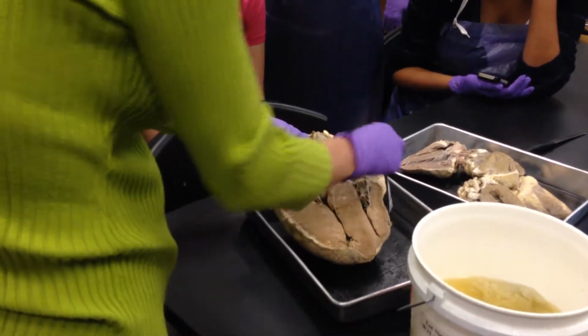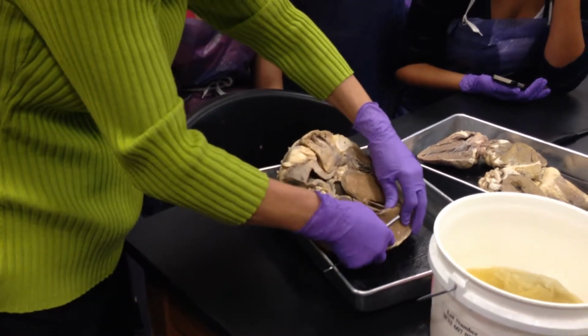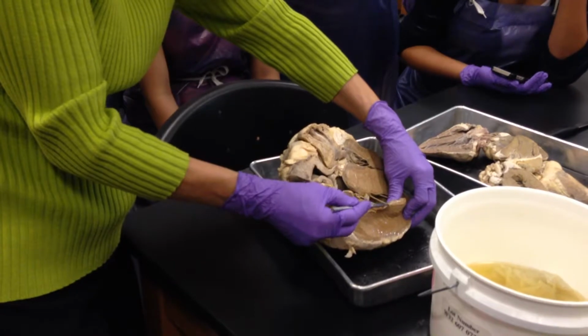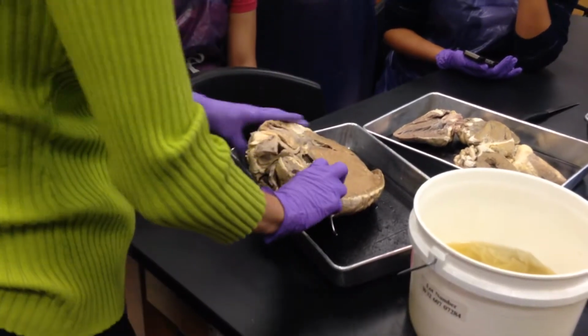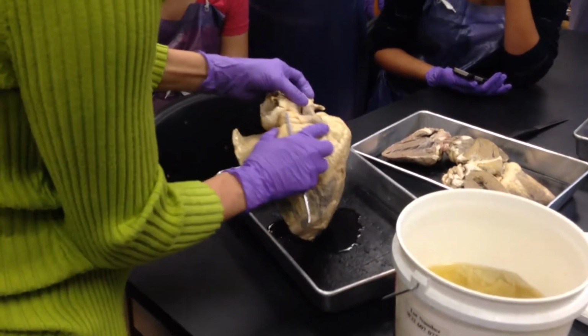Which one is the bump? The papillary bumps is where the chordae tendineae are attached. So see these strings right here, and then can you see that bump right there? Okay. It's like they close the parachute. Yeah. Keep it taut. And then over here, this right here is, we said, the pulmonary trunk at that angle.